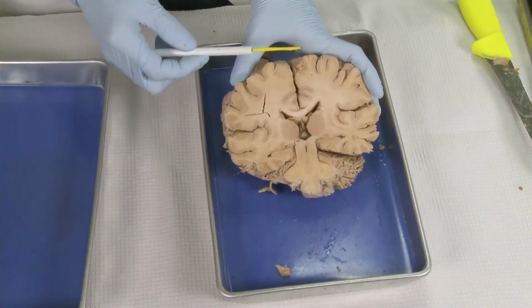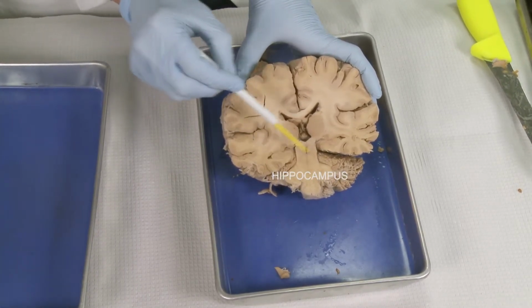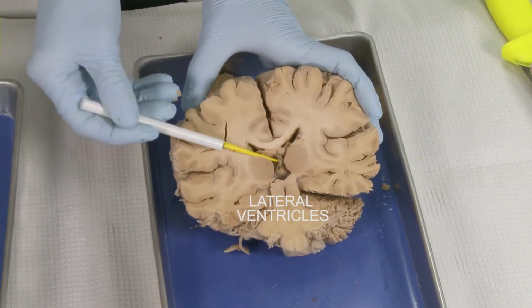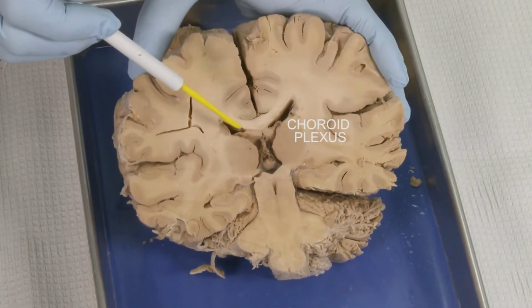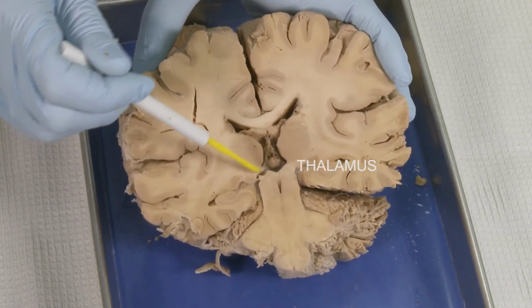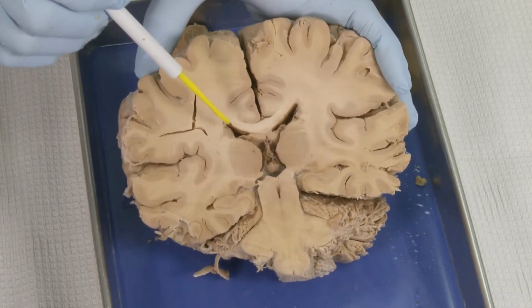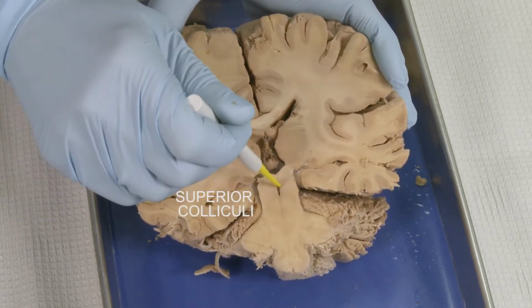So this is a view of the cut through the temporal lobe, and you can still see the hippocampus here sitting in the temporal lobe. Those are the lateral ventricles, you can see them very well. Here you can see some choroid plexus, which makes cerebrospinal fluid. This is the thalamus. What is very visible here is the midbrain. The midbrain has structures called the superior and inferior colliculi. What we can see here is the superior colliculi.